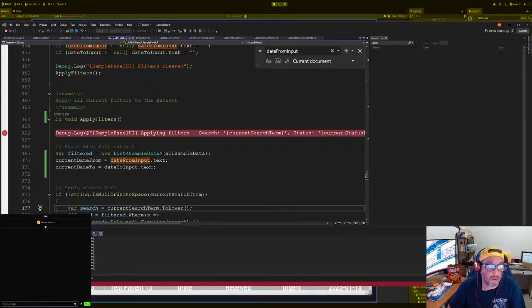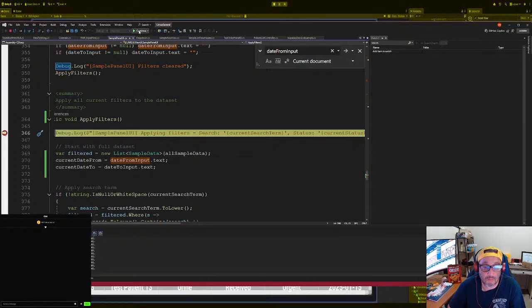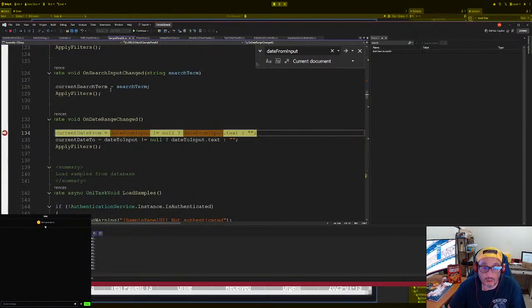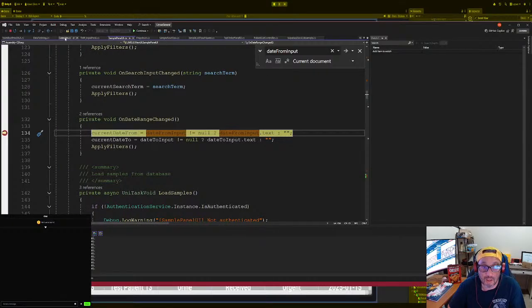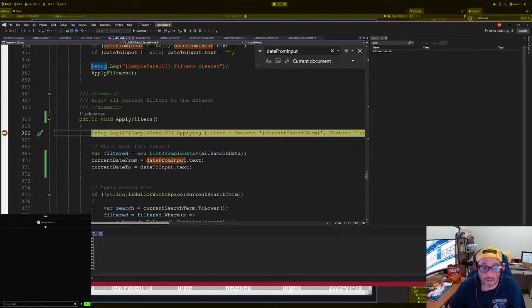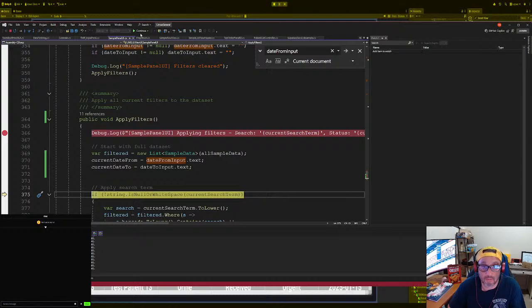All right, so we go click here. All right, we skip the first one. Hit. Okay, no errors. Good. Then we go here. We're gonna make sure that we actually are getting data. Date range changed. Okay, that's good. Oh, okay. We actually hitting the. All right. Cool, cool, cool. Then we go here. Okay, so we actually get the range, and then we should get nothing on this one. Yeah. All right.